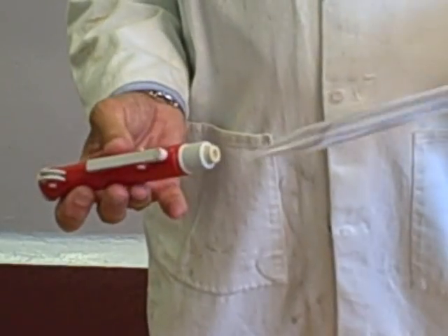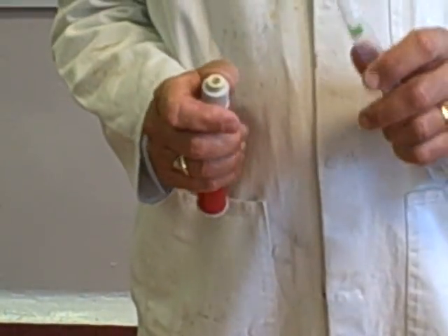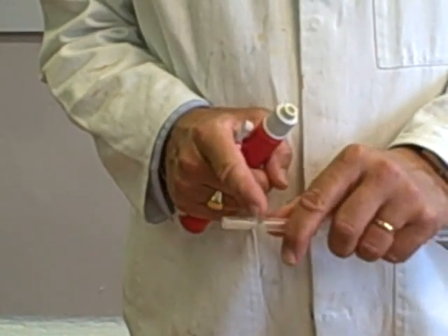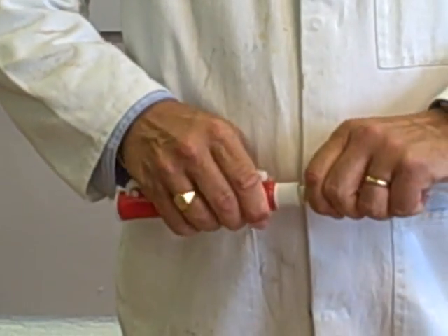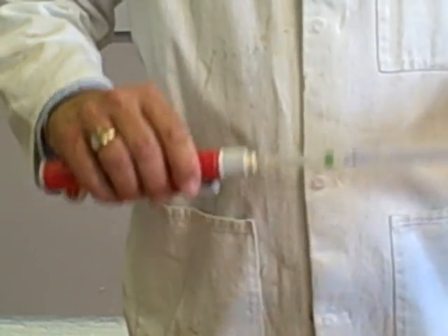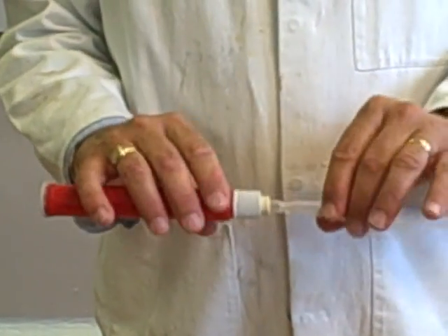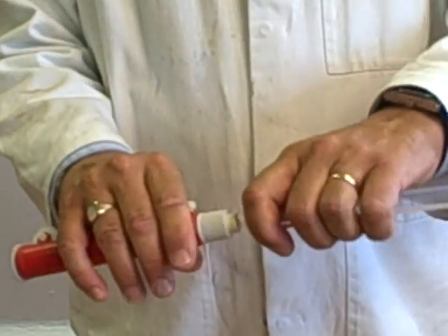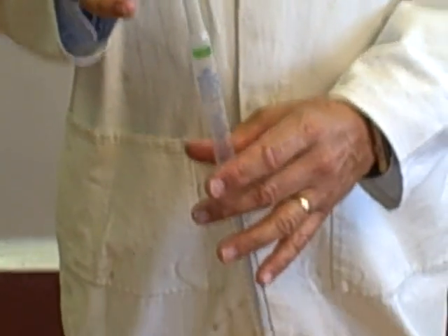So what we're going to do is we're going to put this pipette into this pipette filler. Be careful at this point, and this is something for your risk assessment. This is very thin glass here. You hold it by the top, and you push in that way, and it requires some force. Do not hold like that. Do not, because this can snap, and you could well cut yourself quite seriously. So you hold by the neck of the pipette filler and the pipette, and push. And as you see, that's held firmly.